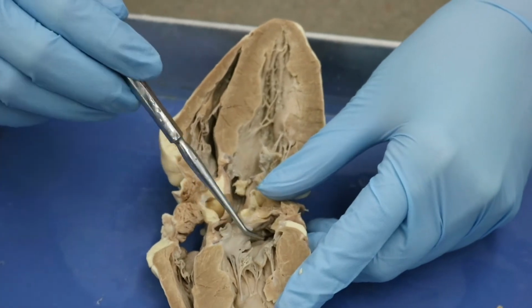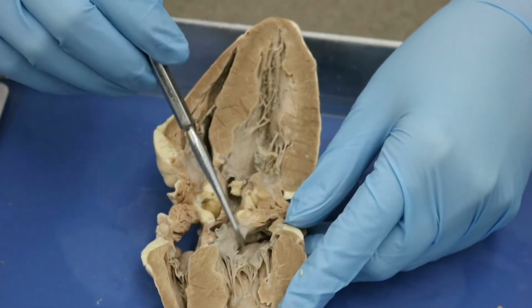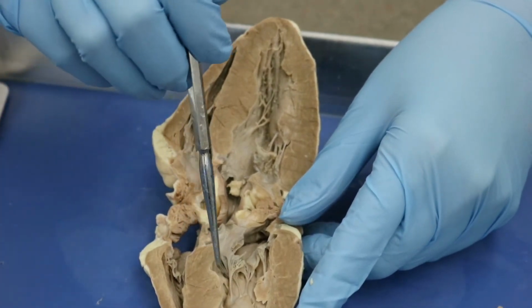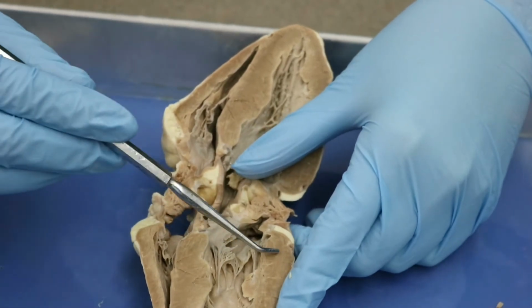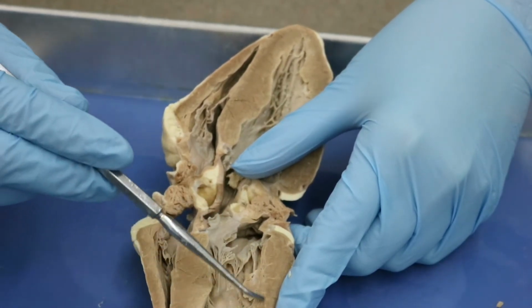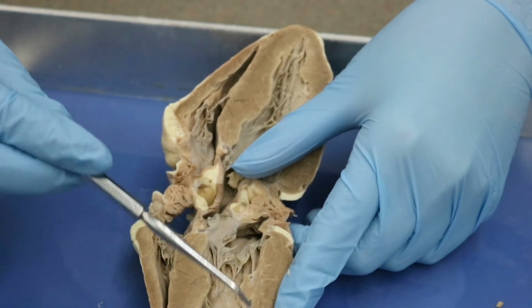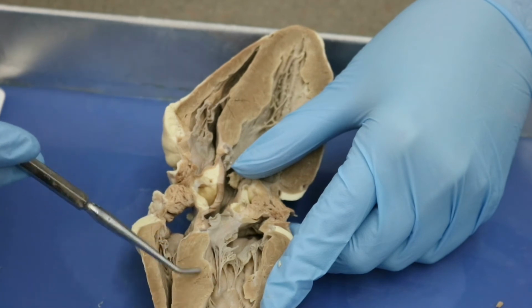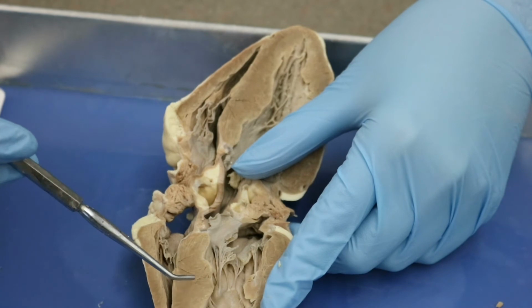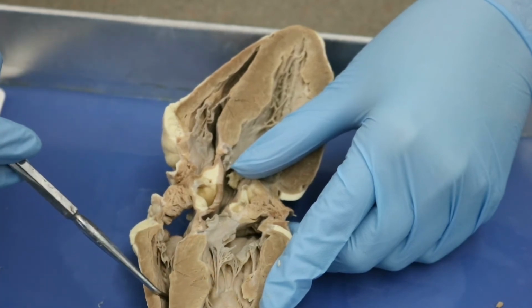Now, within this left atrium, again, we can see the mitral valve we talked about before. We still have our chordae tendineae. We have our papillary muscles. We can still see within this left ventricle that we have a very thick wall on this side. This is helping us identify it as left. We also see the interventricular septum here. And this interventricular septum is essentially the fleshy dividing line between the left and right ventricles, okay?